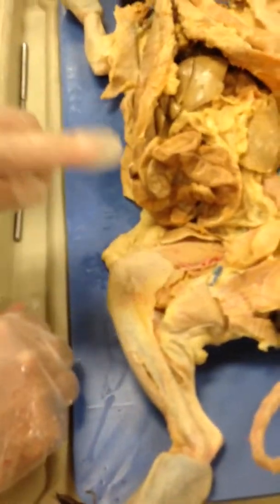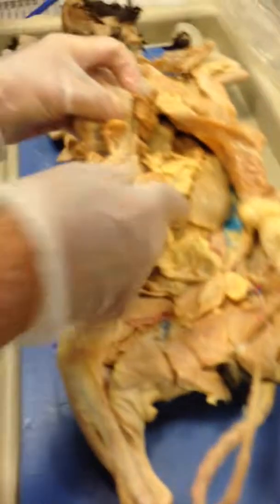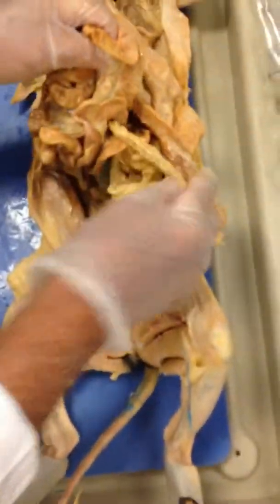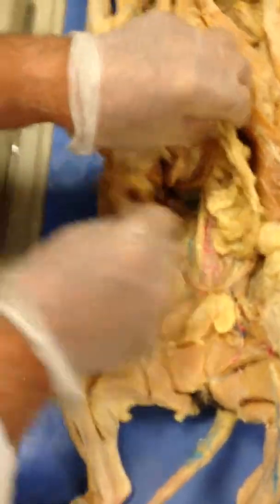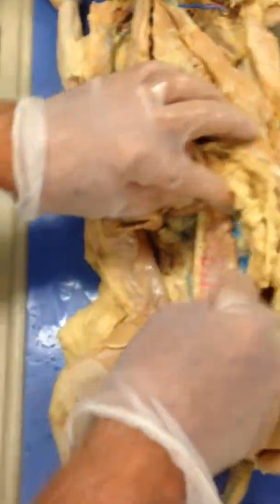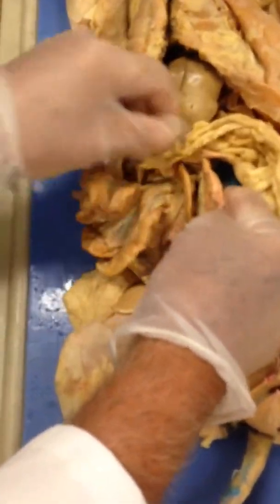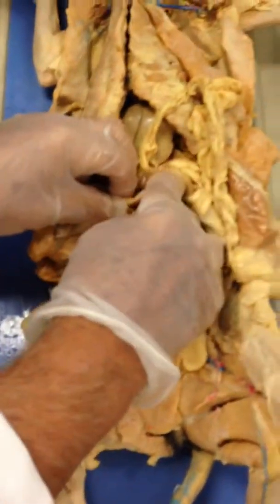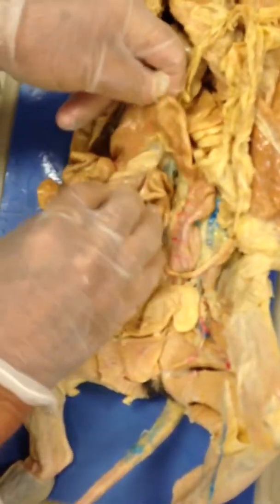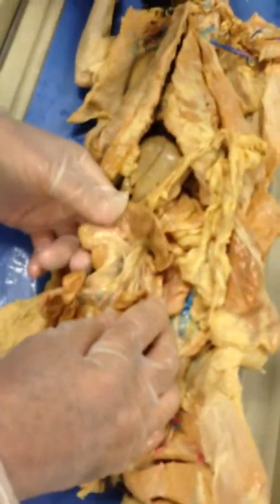Did you find the large intestine where it connects to the small? Did you run this intestine a little bit till you found it? See it over here? See this big tube right here? That's going straight down. See, it's much larger than the small. Where the small one connects to this, you can definitely see the difference in the size. See, it loops around. Right here is where it begins.